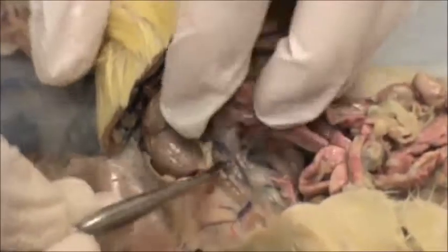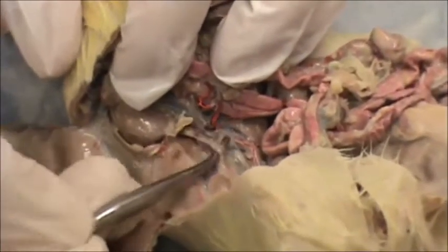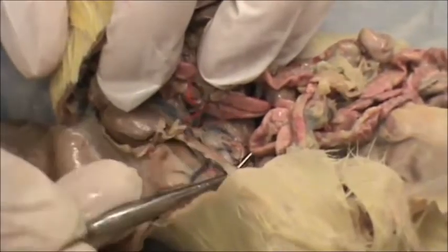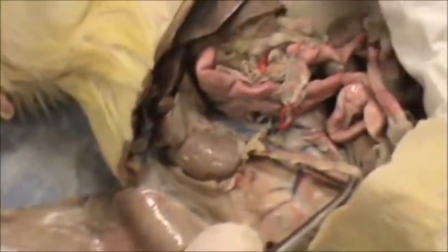It goes down the ureter, which is embedded here, and there's the ureter, and the urine leads down the ureter into the bladder.